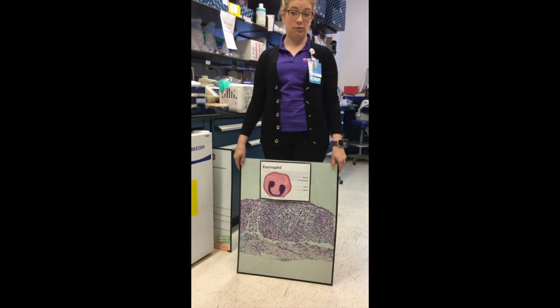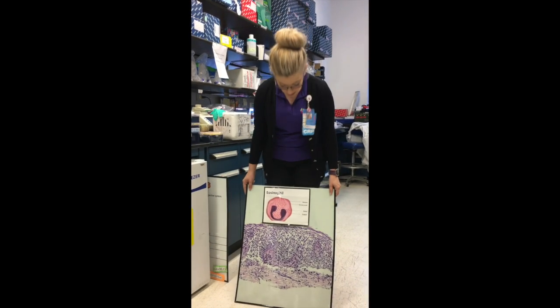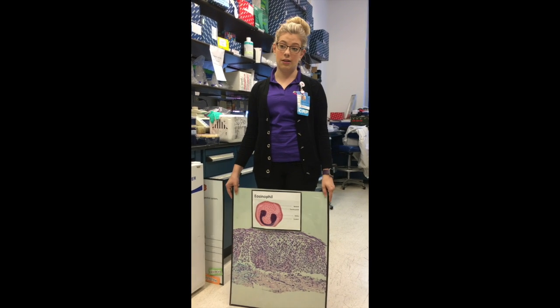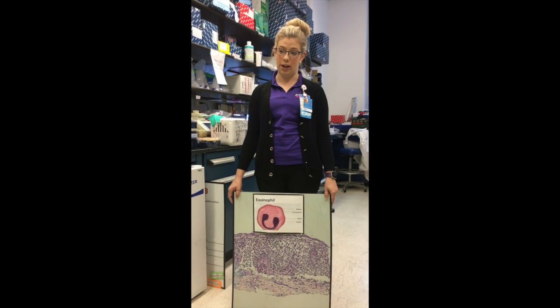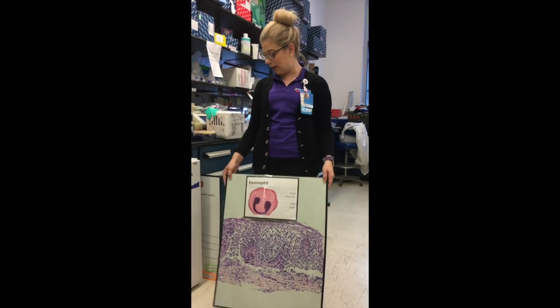You should have none. So healthy people would have none. Zero, none. In their esophagus. In their esophagus, correct. It is in your blood, though. You're supposed to have eosinophils in your blood. And that's what we're looking for. We're looking for this, the big guy.